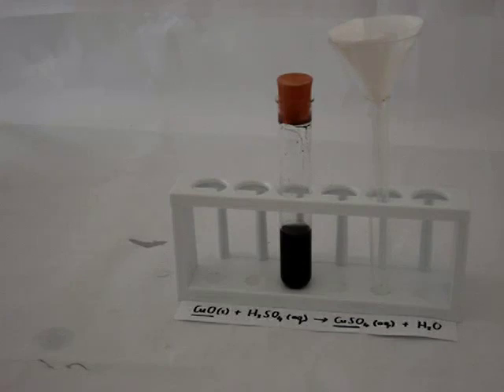What we hope we'll see is that the copper sulfate solution will pass through. So let's try it.